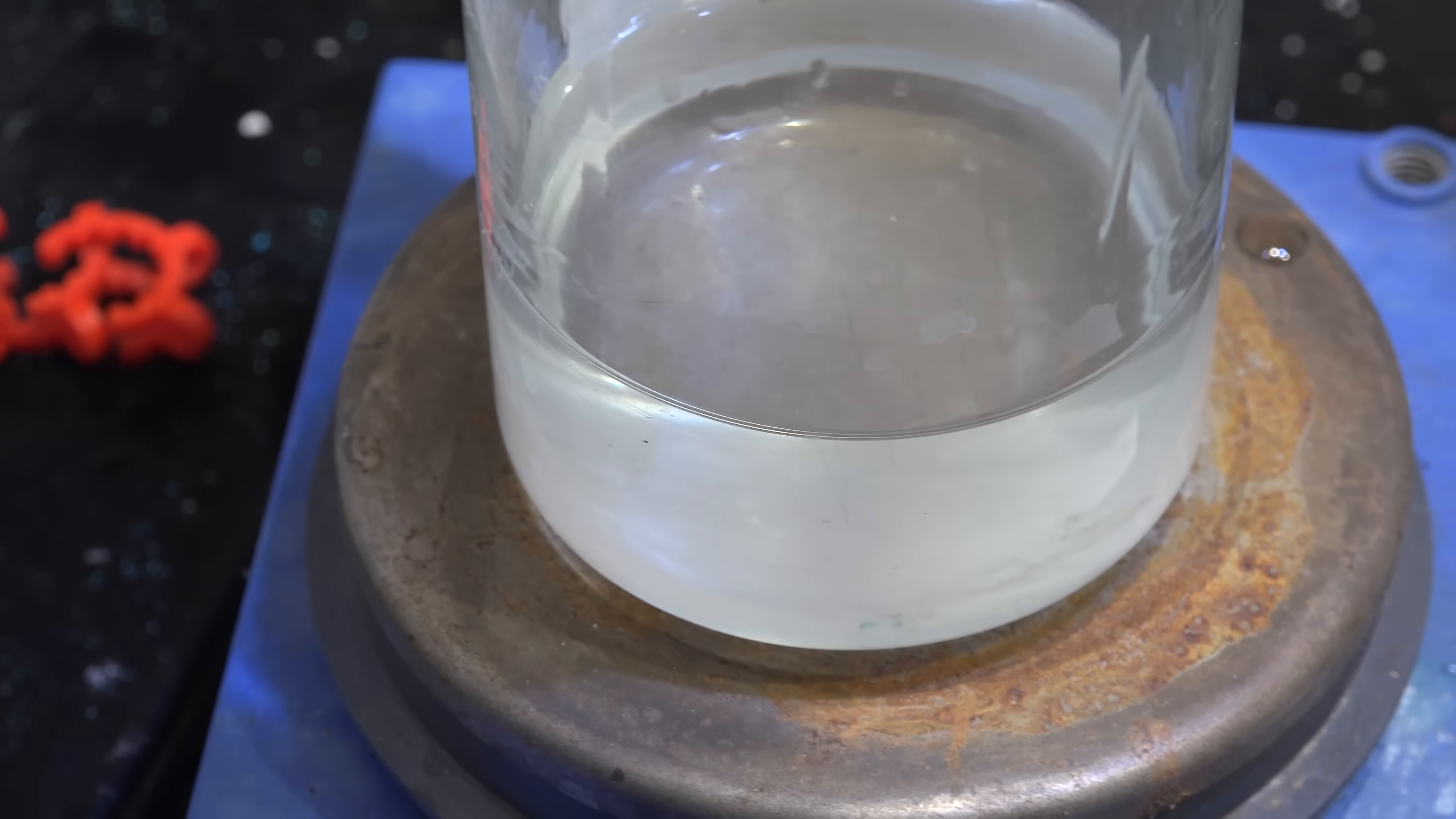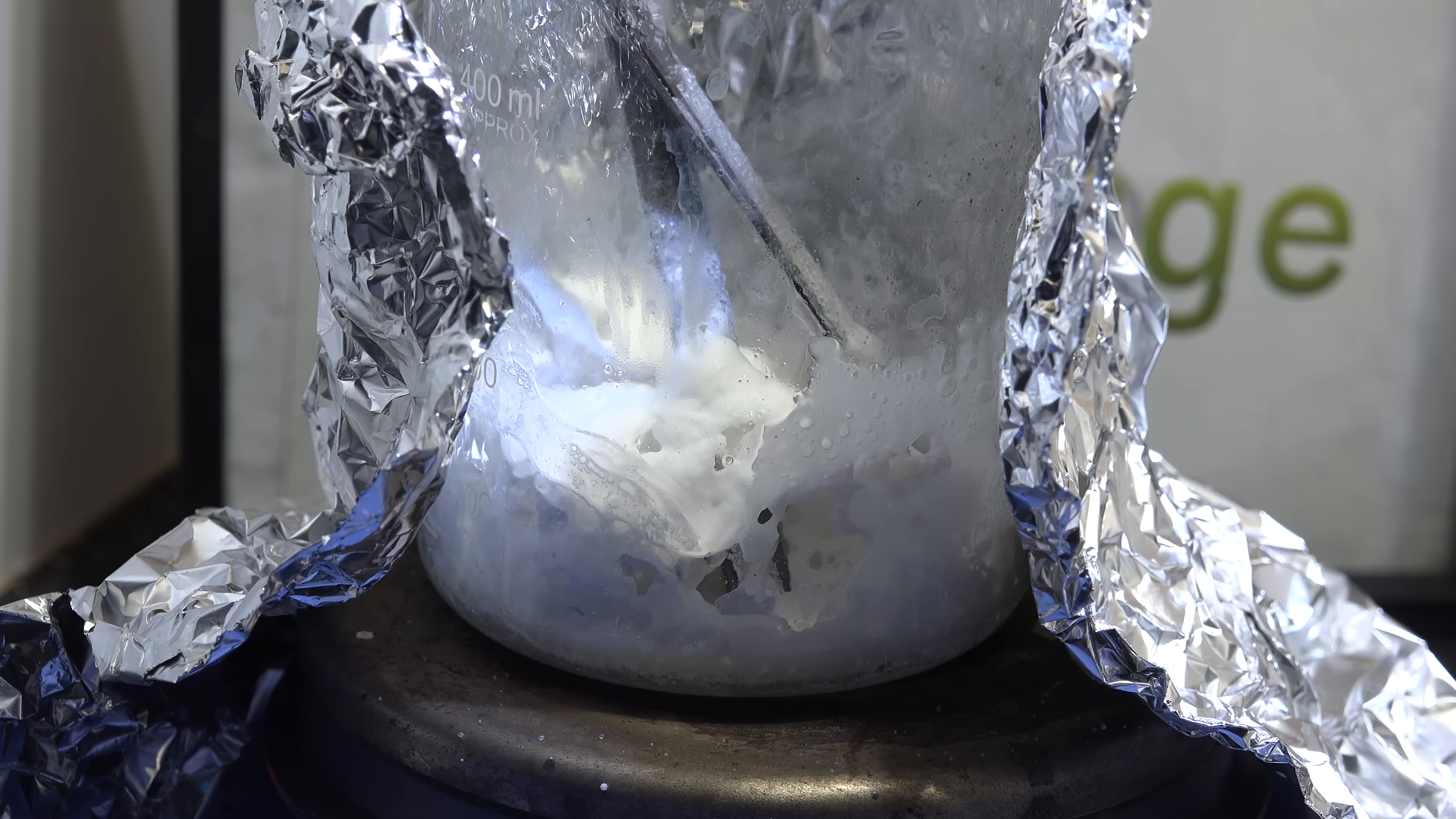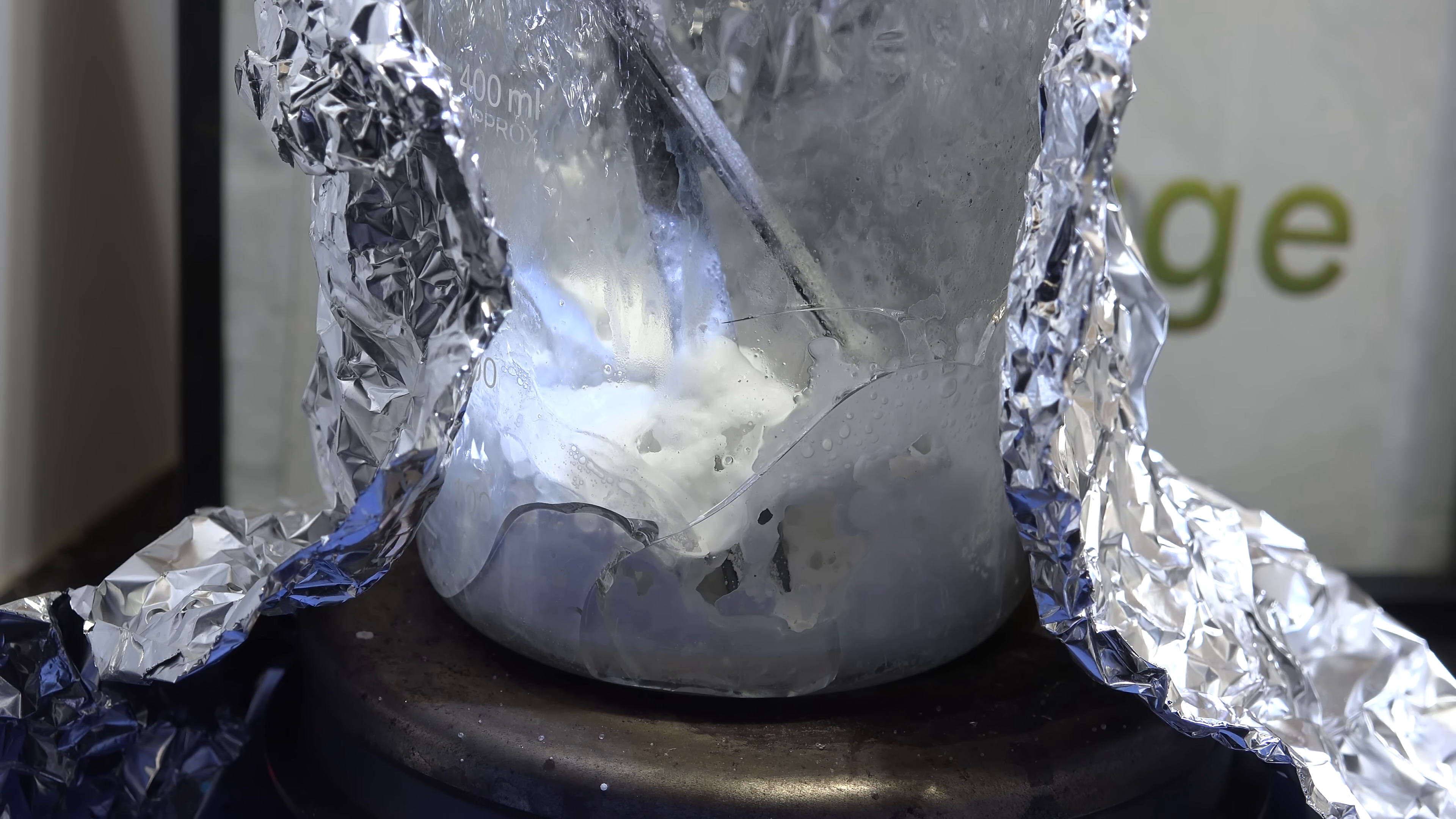And while you can try to boil it dry, I found there was a terrible side effect. While most chemicals boil dry into a powder, sodium silicate dried into a very hard cement that cracked glass.